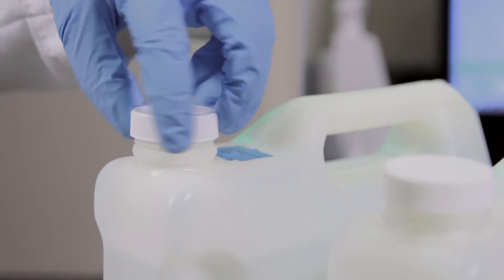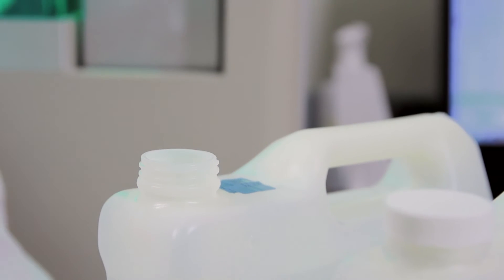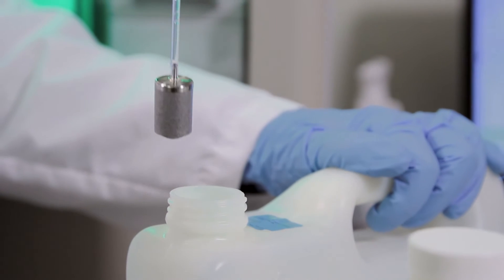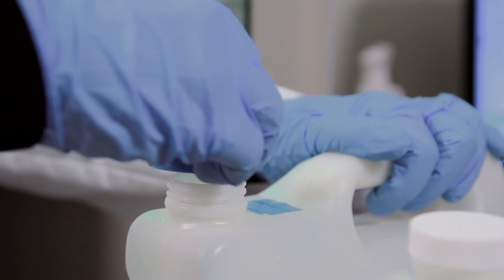Uncap the new bottle, insert the cap assembly and then tighten the cap, making sure the cap is tight enough to prevent air from entering the system.